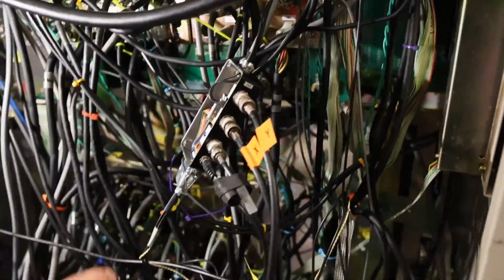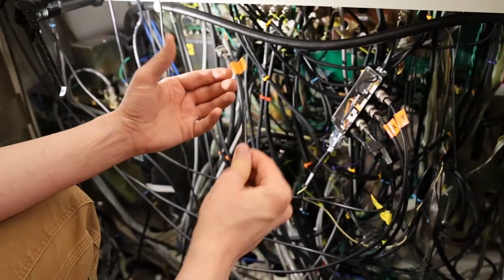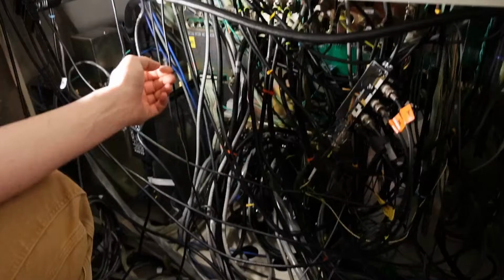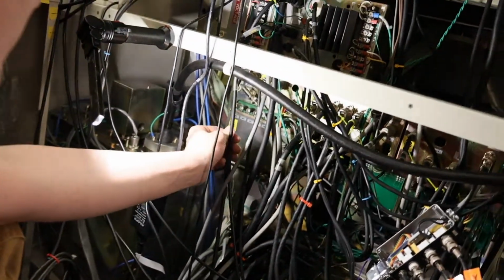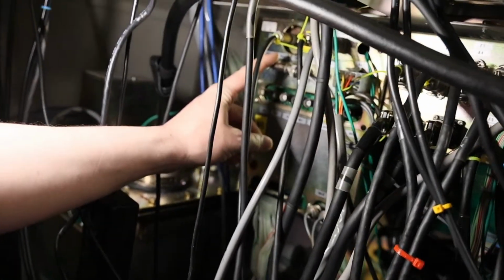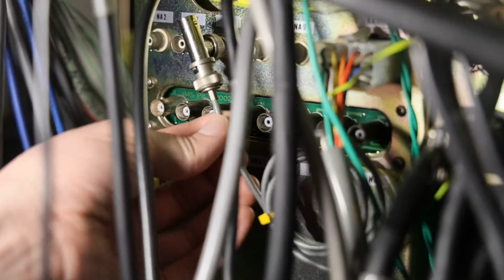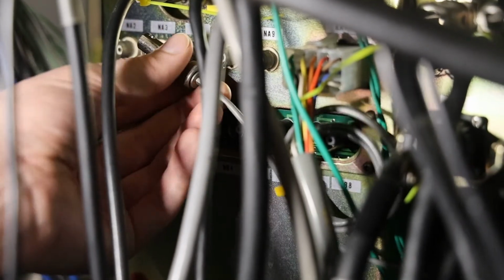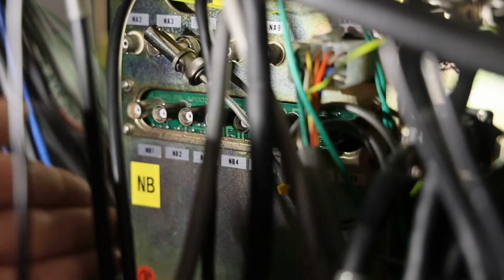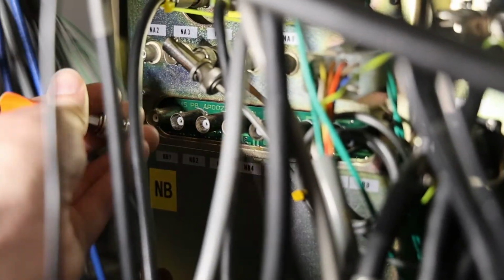So those are our X and Y inputs. The other thing we need is to get video signal back out of the microscope. For that, I've got our BNC that we're using as the detector down here. On this particular microscope, we are using NA7 down here as our primary image output. And there is currently, and we can zoom in on that, a T installed on NA7 here. I don't need to take away the image signal from the microscope. I just need to tee off of it. So we don't need any relays or anything. All we need to do is plug our detector cable for open beam interface into a T on the microscope.